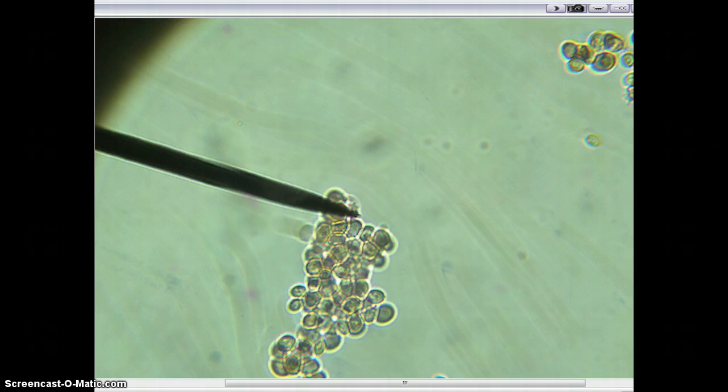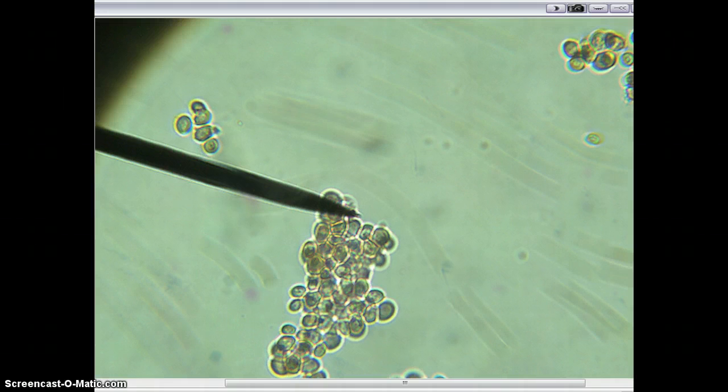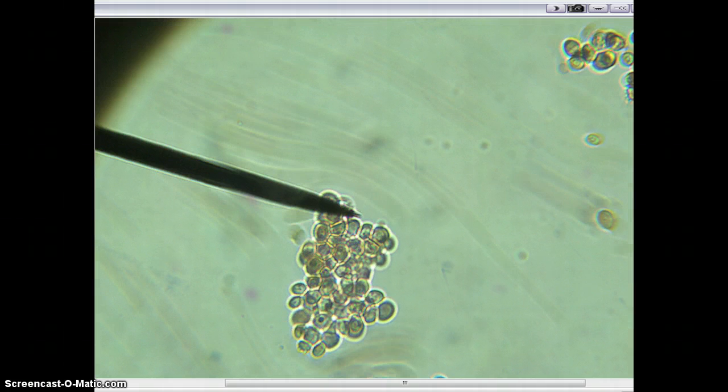And this is one of the transport systems we have talked about. One was living, and one was dead. This is an example of active transport. This is not diffusion, this is not osmosis, this is not facilitated diffusion.